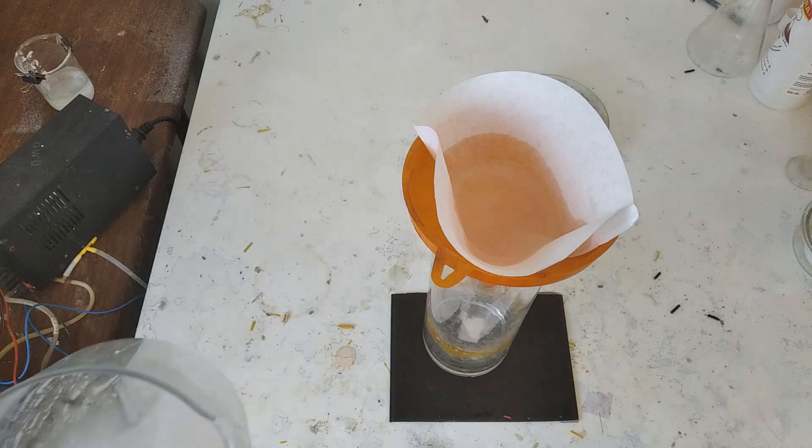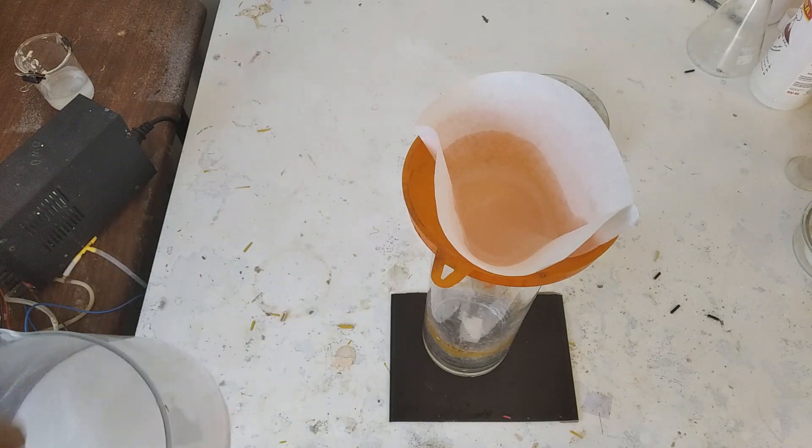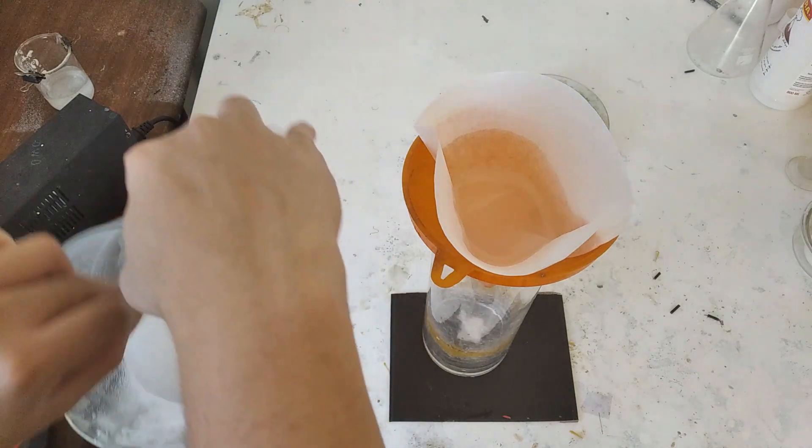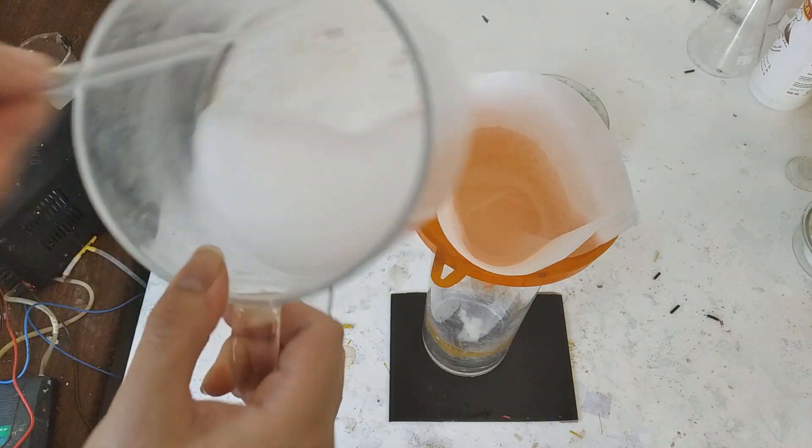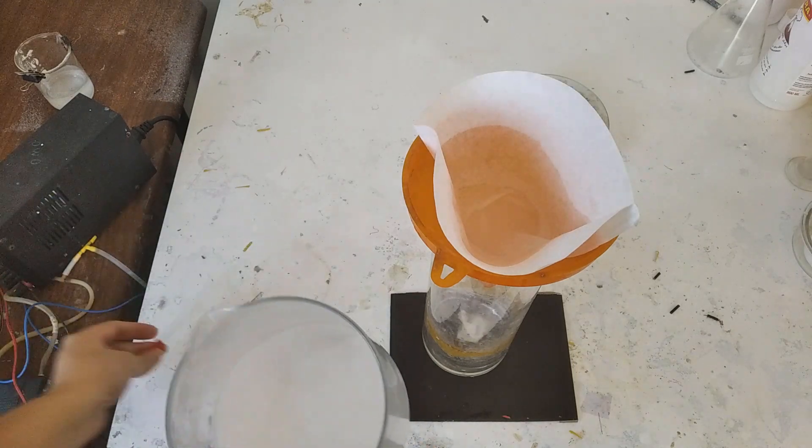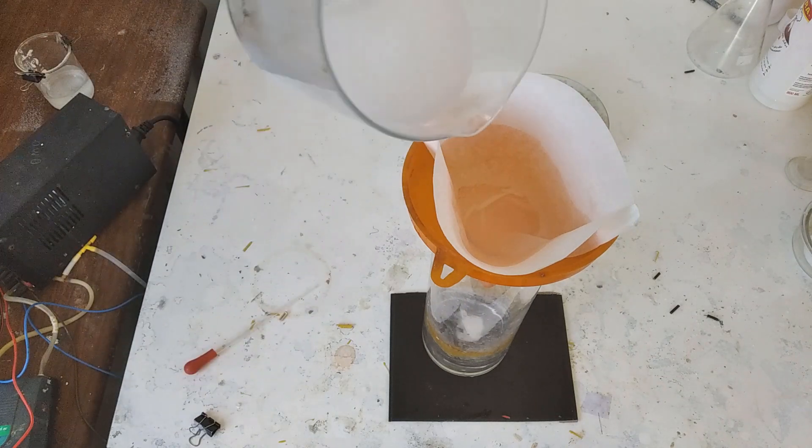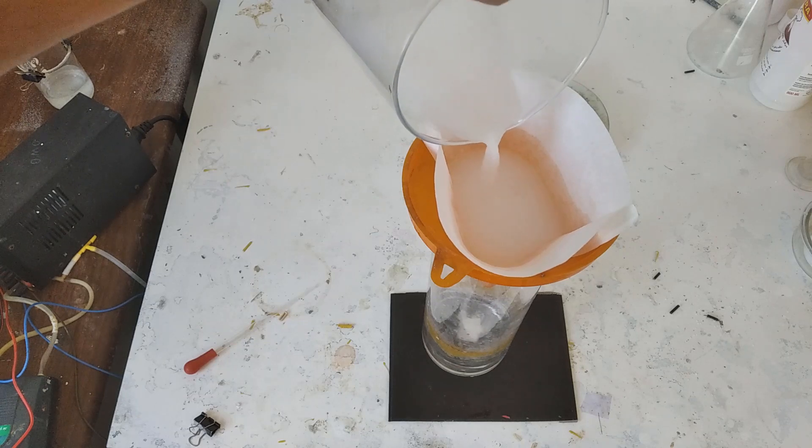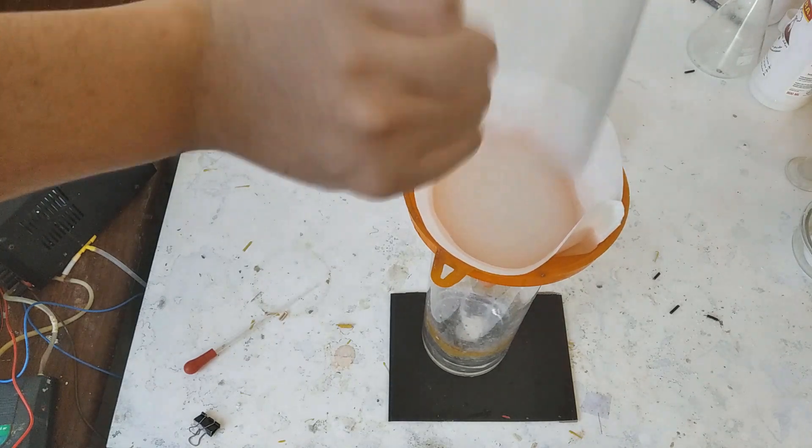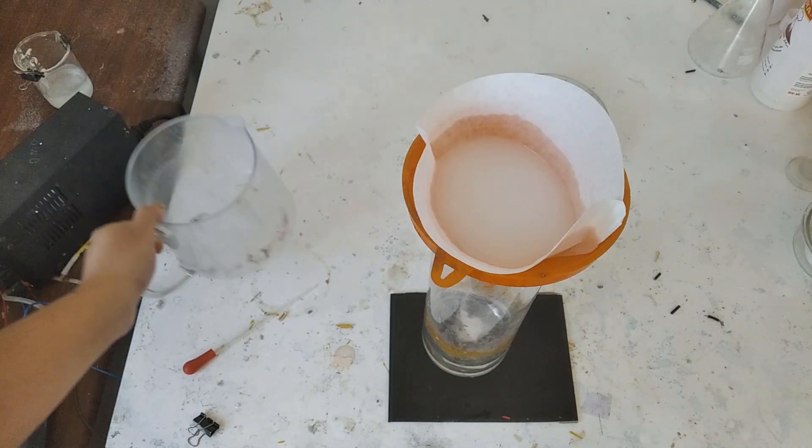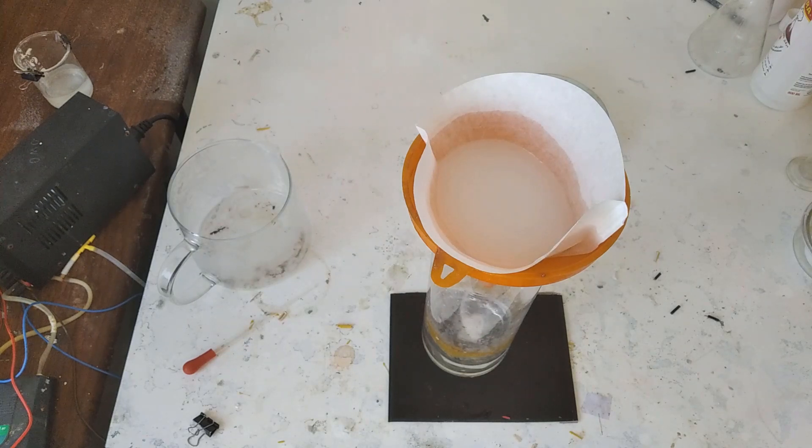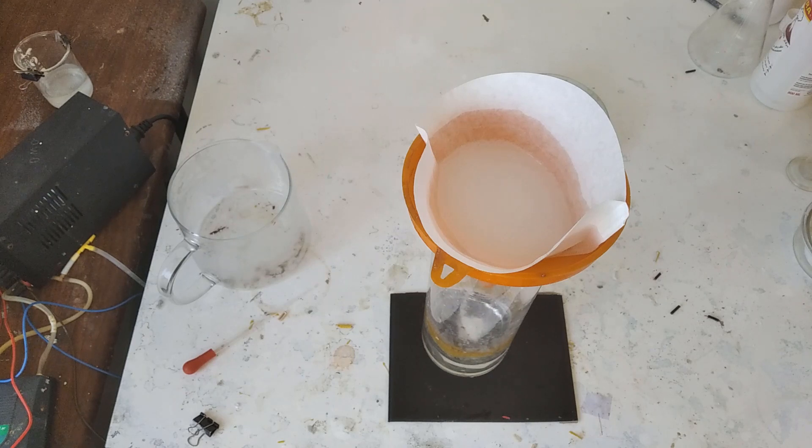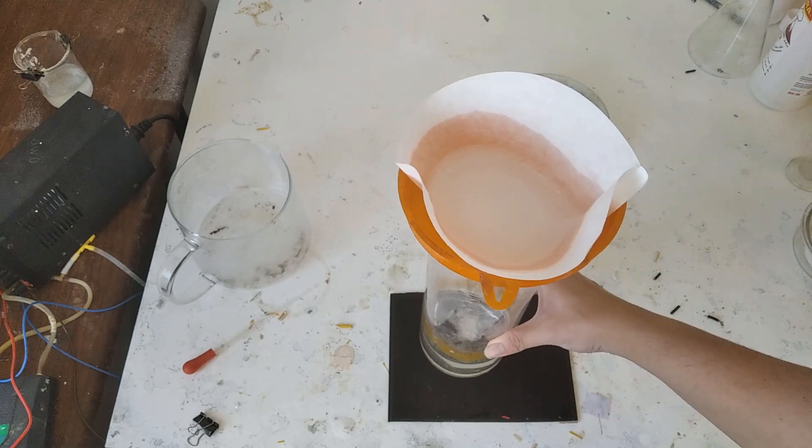So you have to filter it now to separate it from whatever else over here. I'm just scoring the bottom because as these things precipitate they tend to stick, you know. The thing to do is just swirl it like a madman before filtering. It actually slows down the filtration, it's just that a lot of this stuff is sticking at the bottom of the container that pisses me off. I mean that would piss you off, you look at all this stuff stuck to it. Now whatever, I only need like two to three grams for my thing so that's all you really need. So we just leave this to filter.